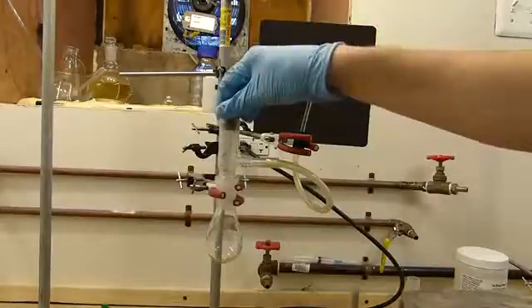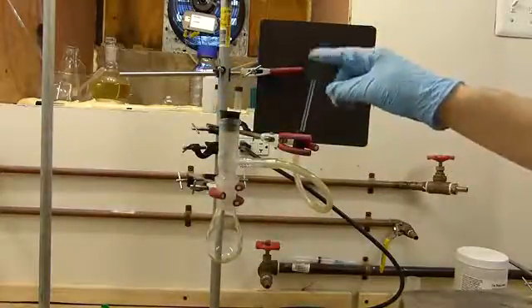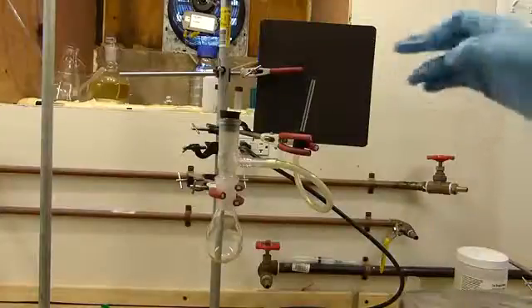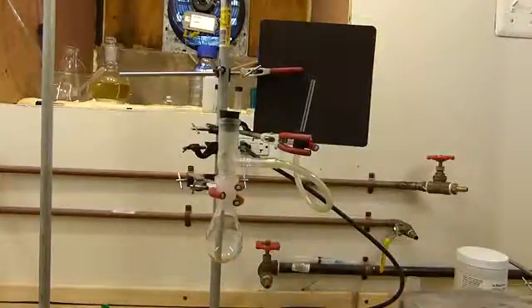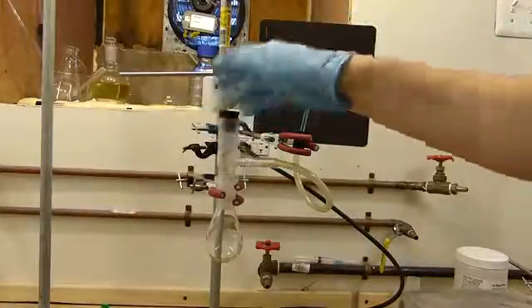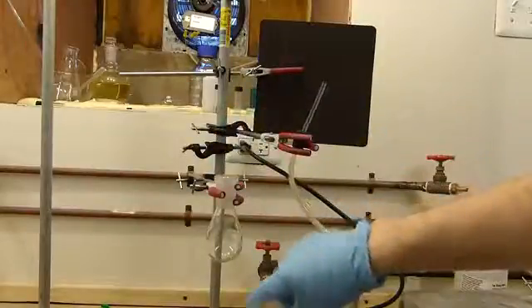So the stopper is in place, and this apparatus is all put together loosely in the event that when I do ignite it at this tip, if the carbon monoxide in this tube and the whole apparatus happens to be somewhere between the lower and upper explosive limits, I won't destroy my glass apparatus and spread acids everywhere. Instead, it'll just pop the cork or this joint here. So to start the generator, it's pretty easy.